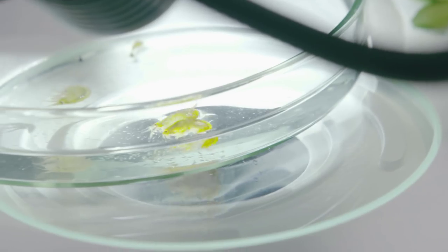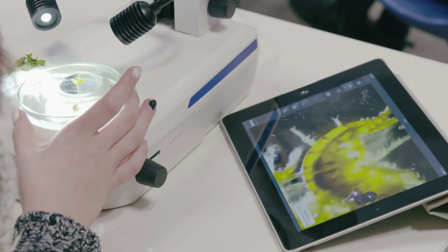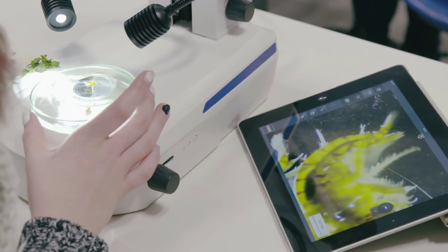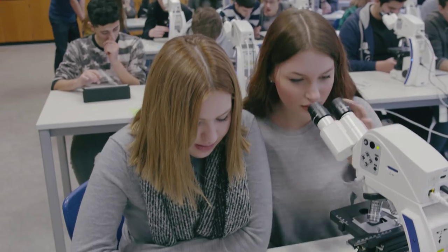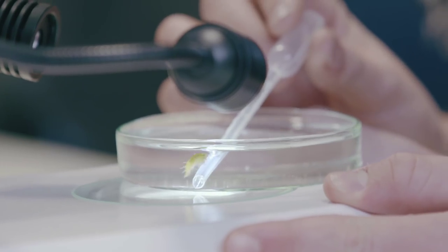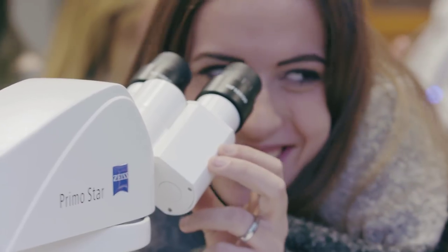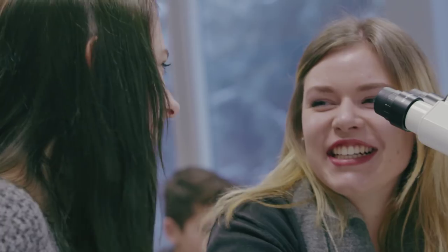The students are growing up in an increasingly digitized and interconnected environment. So it is especially motivating for them when they get to work with an everyday tool in biology class, and thus benefit from this interconnectivity.